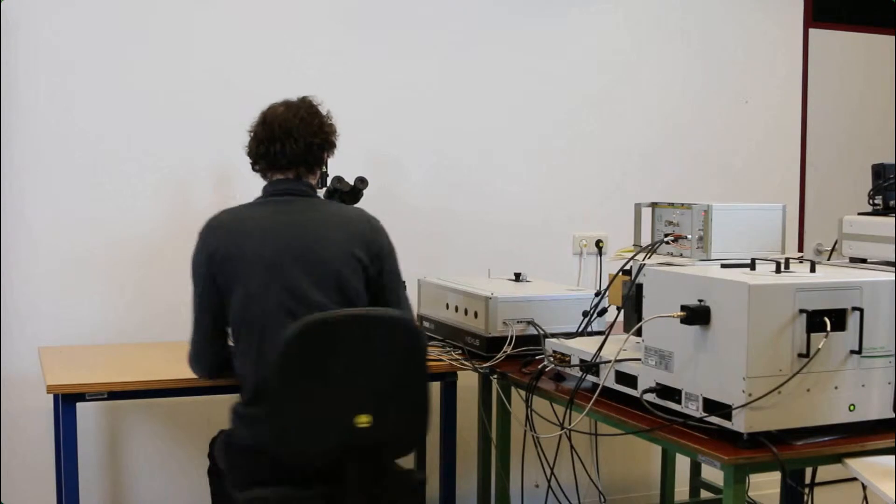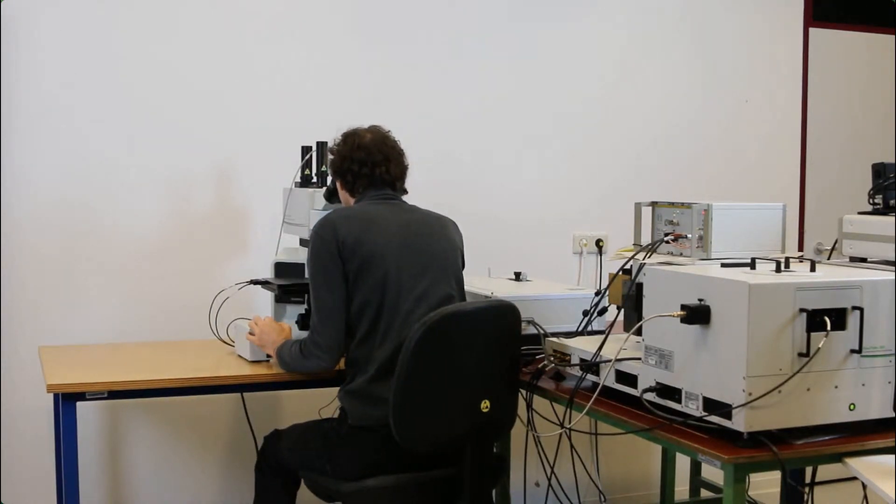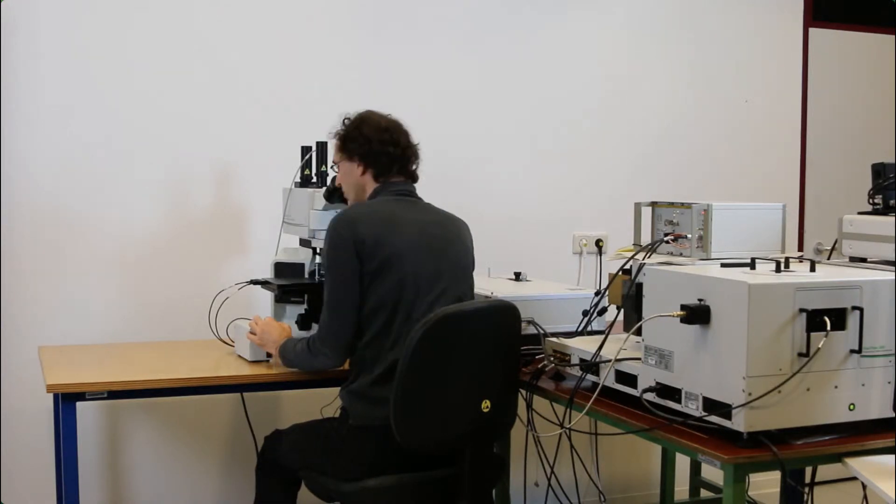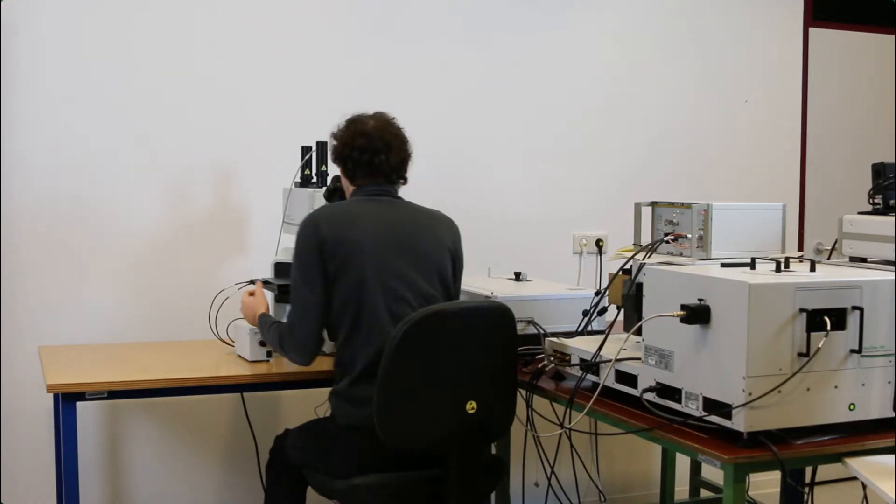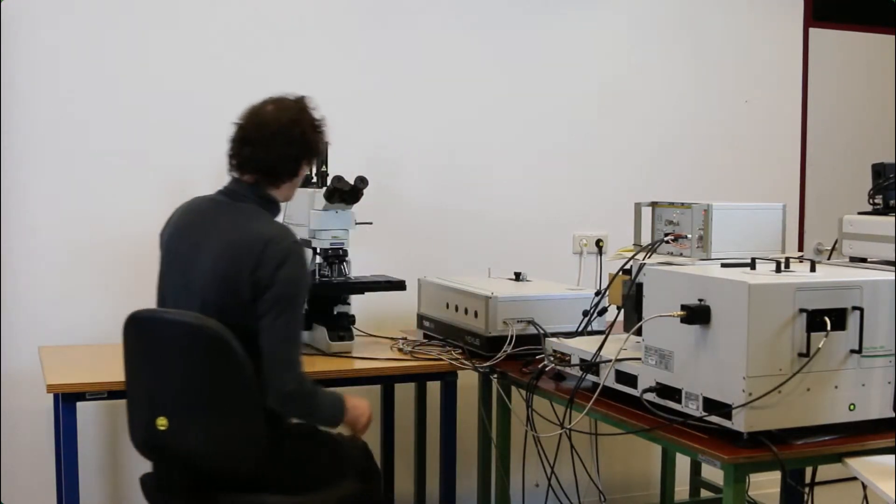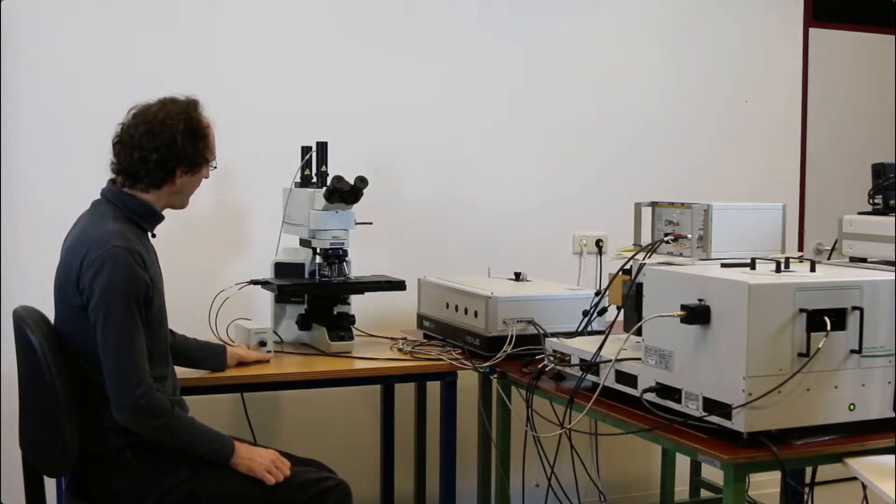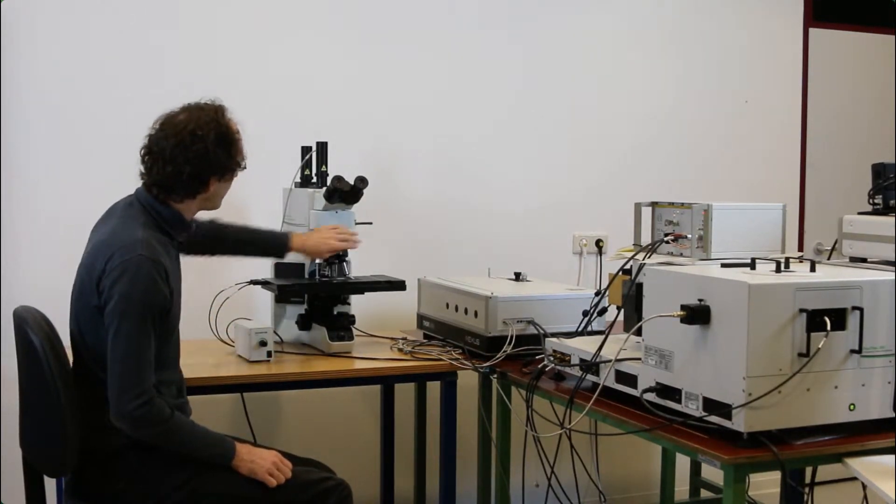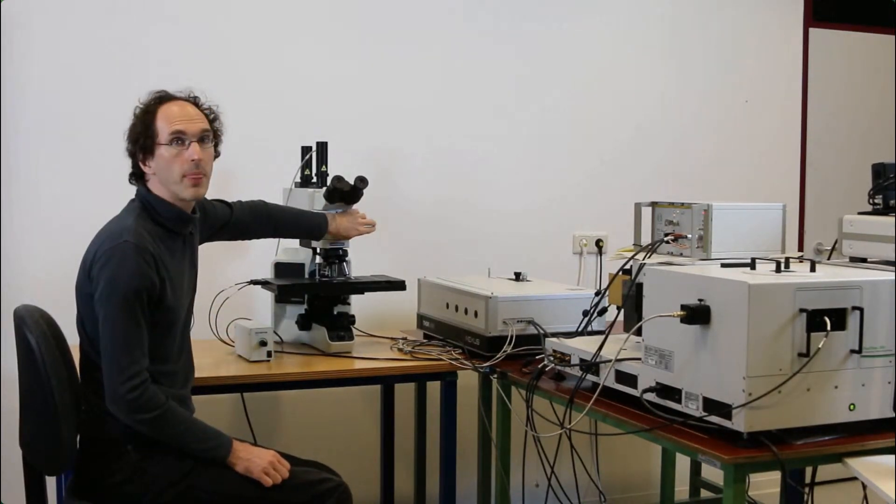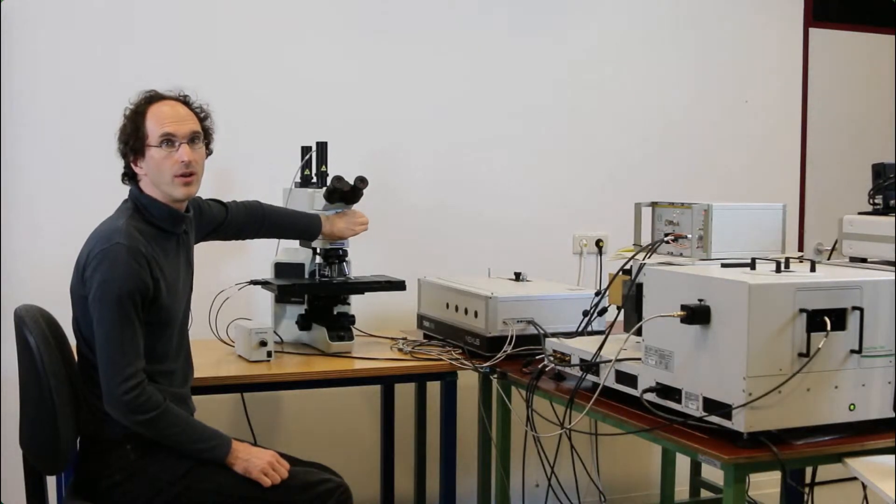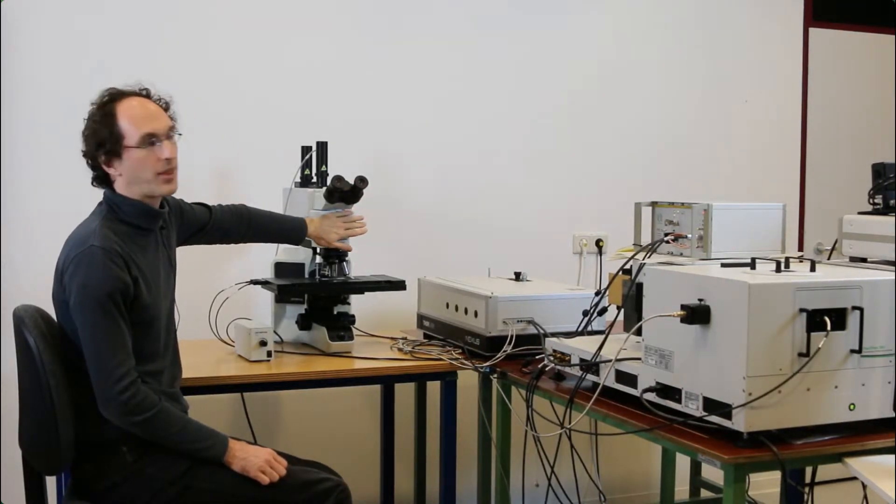The lamp you can turn on here and you can set the intensity of the transmission lamp. I will just look now through the ocular and focus the sample to where I get a good focus. After I finished, I first switch off the lamp and then return back to the confocal beam path.